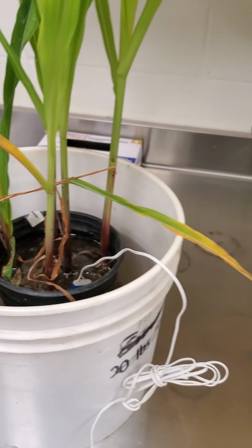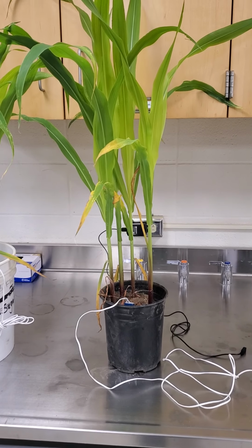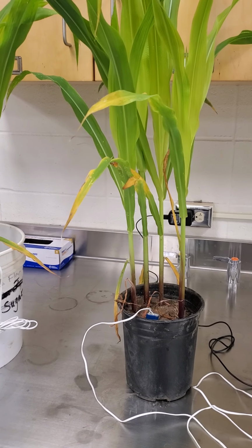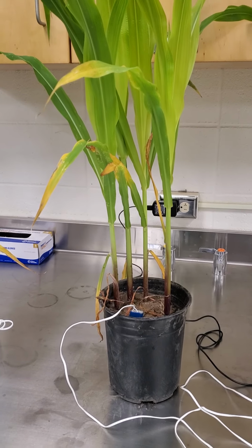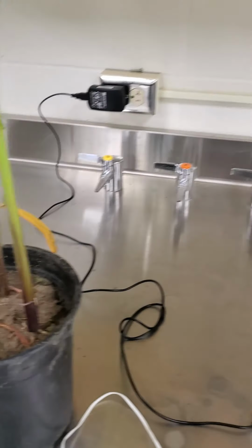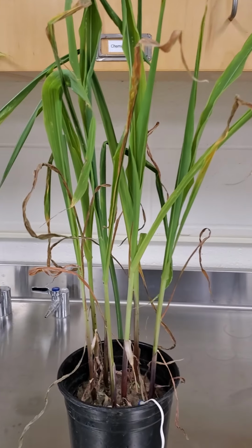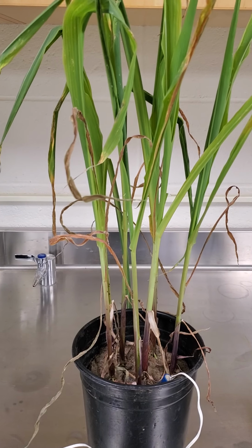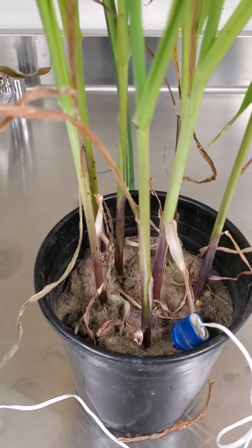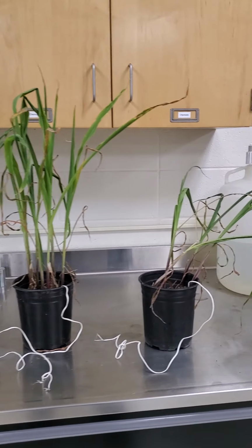It's inundated with water. The second one here is what we would call a moist wet, which means that it's watered pretty well, and there's plenty of water available, but not so much that you have standing water or anything like that. The third one is a moist dry. This is where it gets a little bit of water, but not a lot, not enough to meet the plant needs, as you can see. It's going to be drier and harder to maintain the water for plant growth.